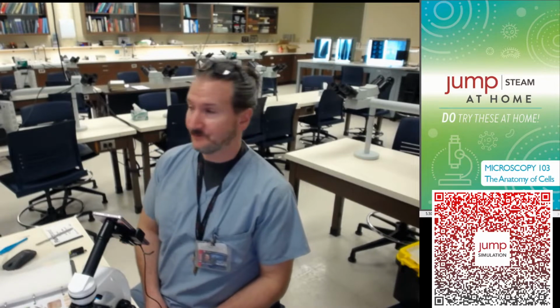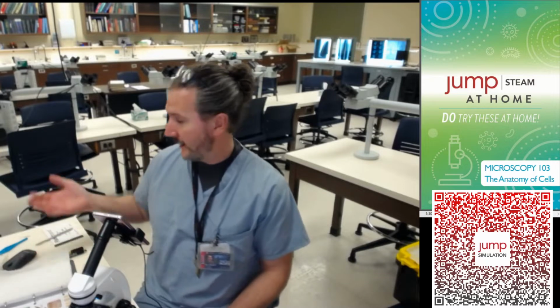and I figured where's a better place than to come to the microscopy lab at the university, where medical students are learning to look at cells that are disease-causing cells, so pathogens, looking at what happens as a result of that, so pathology, like cancer cells or diseases that happen to human cells, and then also look at some healthy cells like muscle cells, heart cells, so that they know what normal looks like and they can compare them with disease states. So we're going to jump right into the book.